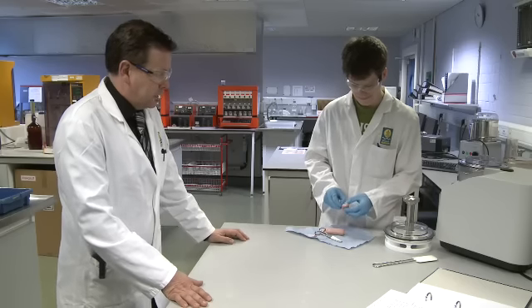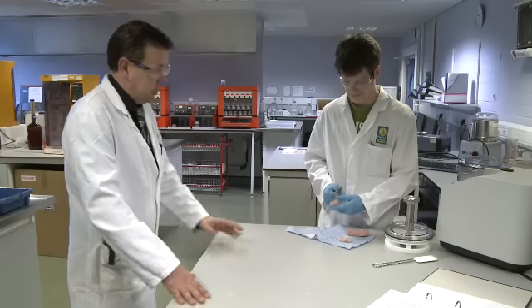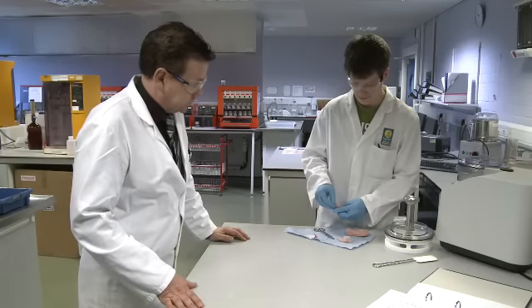Homogenisation of the sample is absolutely crucial. The homogenisation process involves putting it in an industrial blender and spinning at very high revolutions to come up with a sample that is absolutely intrinsically mixed with one another.